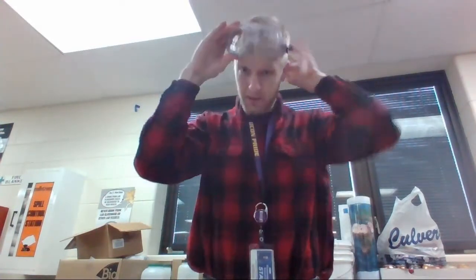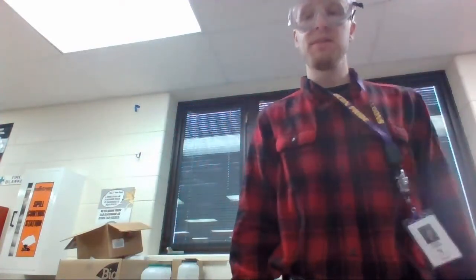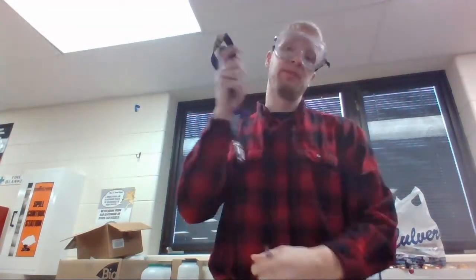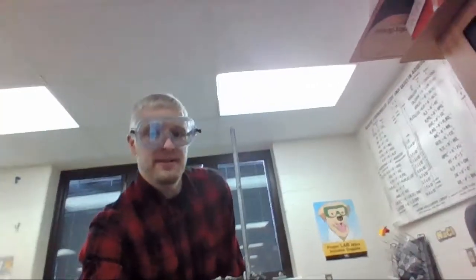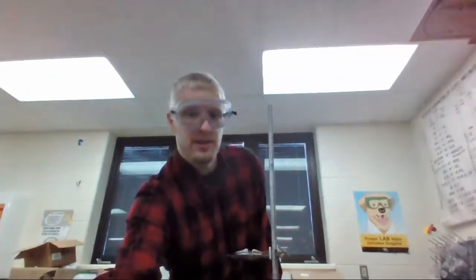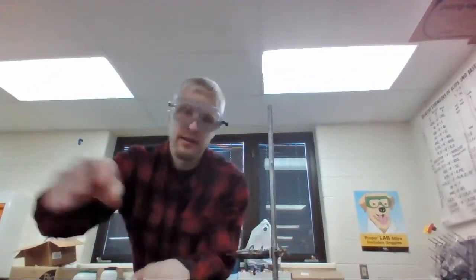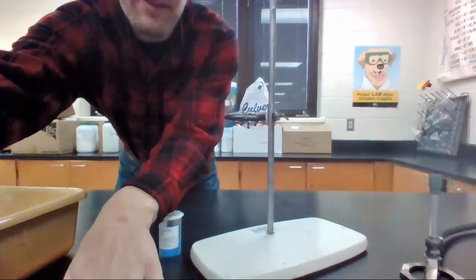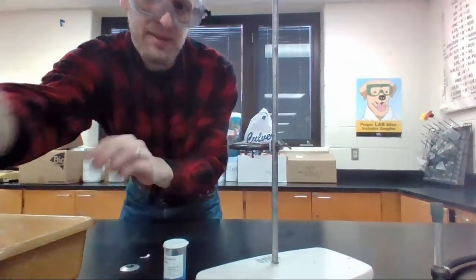The first thing we need to do is goggles. Safety first. I'm set for the lab right now. Except I got this little dangly badge and I'm using Bunsen burners. I don't want to have that dangle. So I'm going to take this off for now. Still staffed. And setting this up here without burning and messing my computer up.